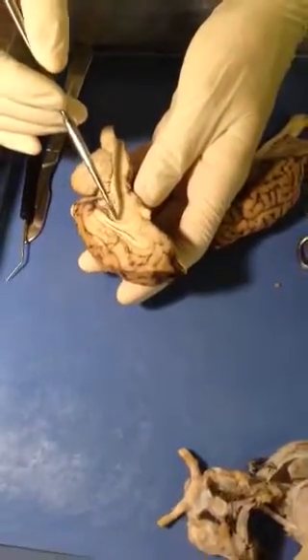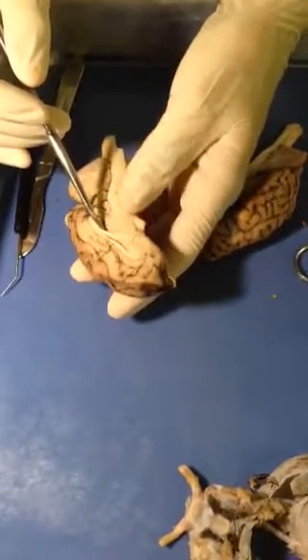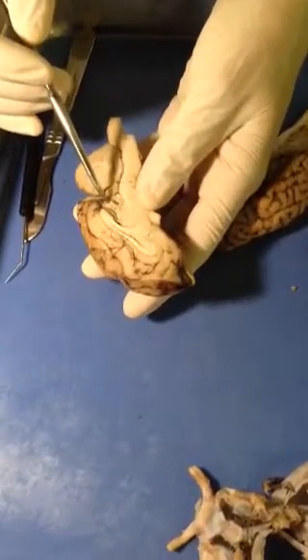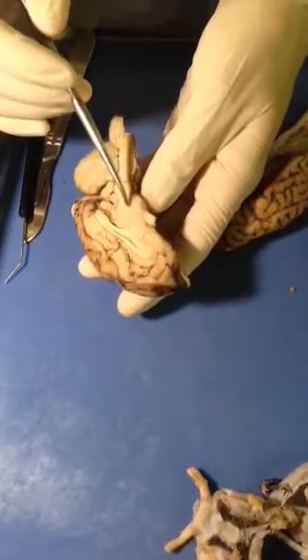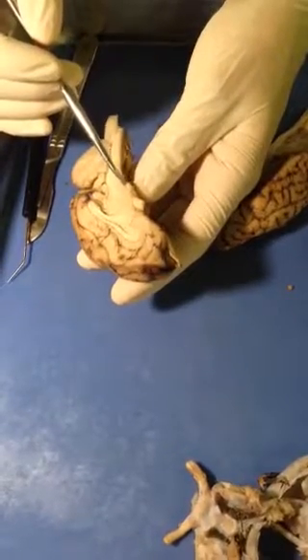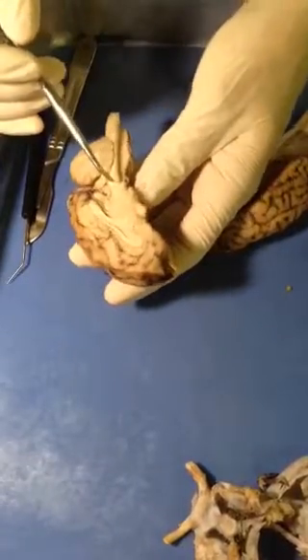The epithalamus runs along the top of that, right underneath the third ventricle, which is that opening here. And then the pineal gland attaches, and that's that mass there. On the bottom of the thalamus is the hypothalamus, and that goes down around there. And here you can see the mammillary body again, which is that little mass sticking off there.